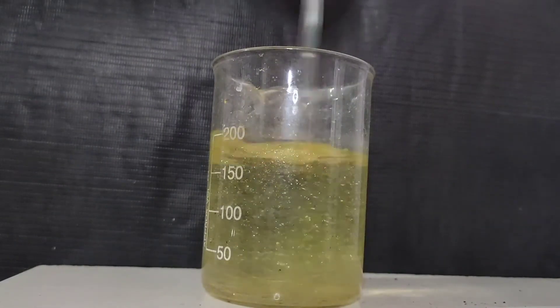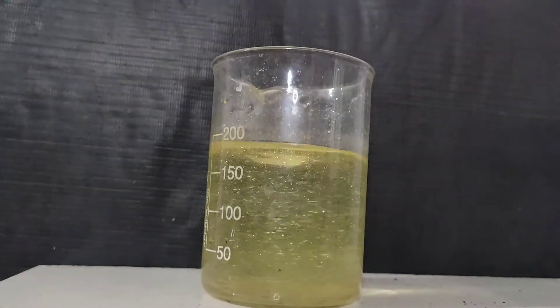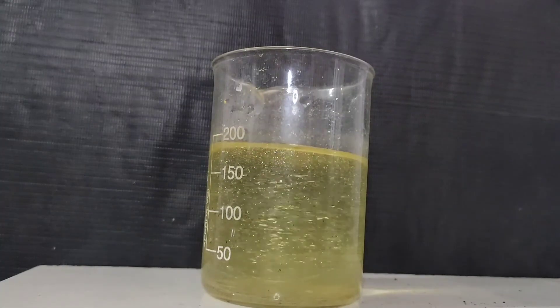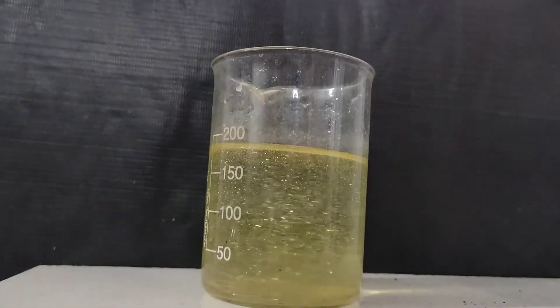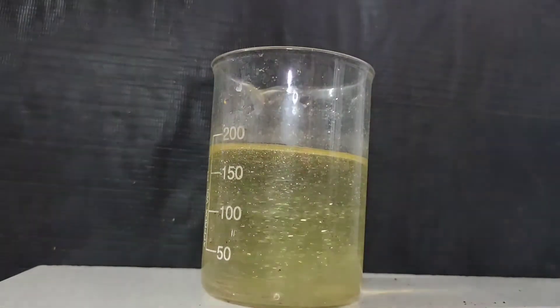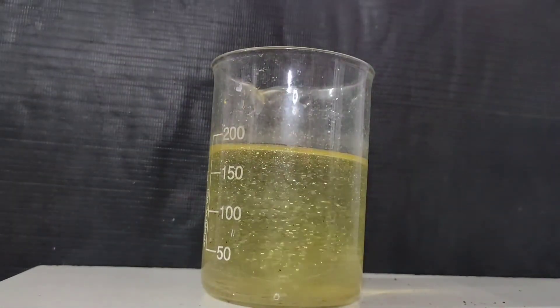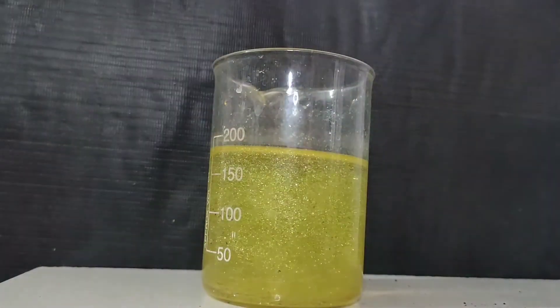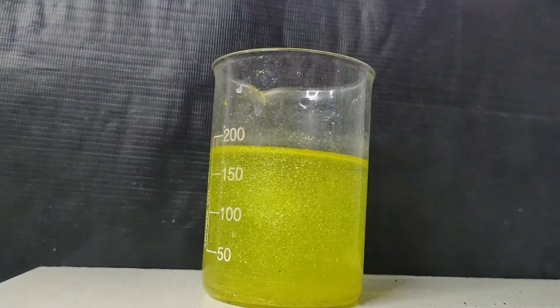On cooling, you can see that golden glittery crystals of lead iodide separate out. This experiment is commonly known as the golden rain experiment, because the crystals of lead iodide appear as golden rain.